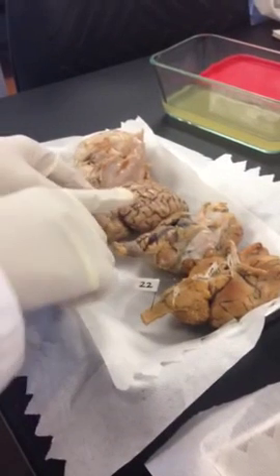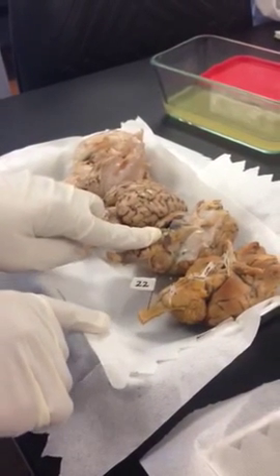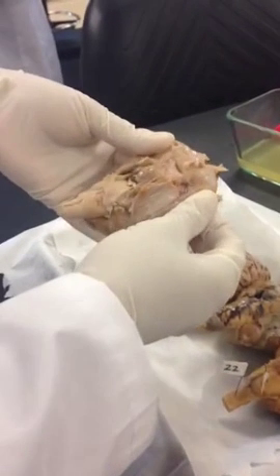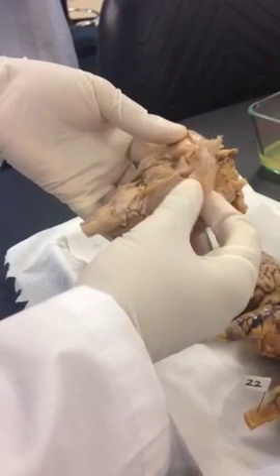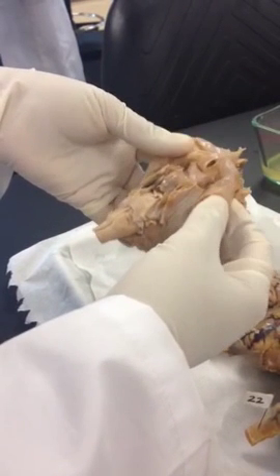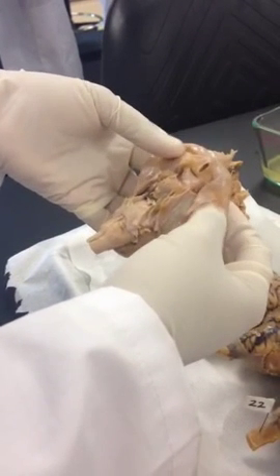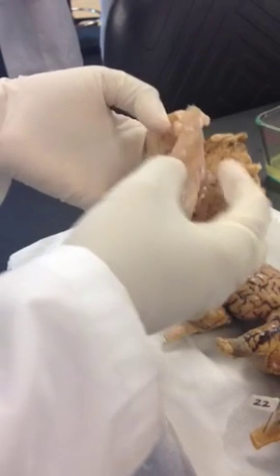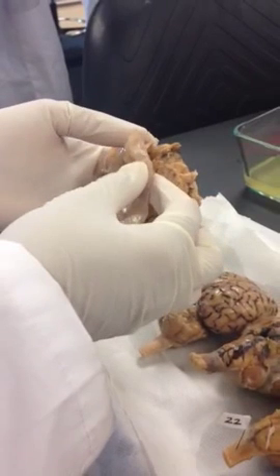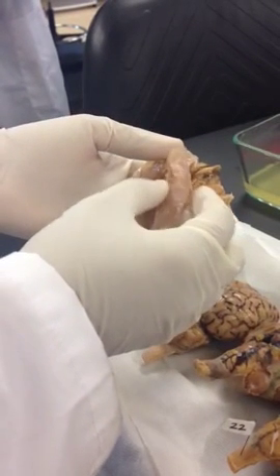This is the superior view. This is the inferior view. This one is having the covering, which is the dura mater on the outside. We call meninges in general. Dura mater is the thick fibrous connective tissue layer you see outside, but there are three meninges in the brain which make the covering. The outside is the dura mater.